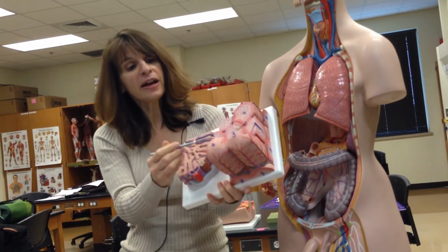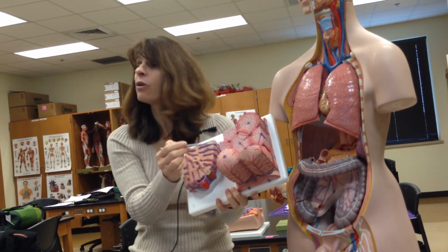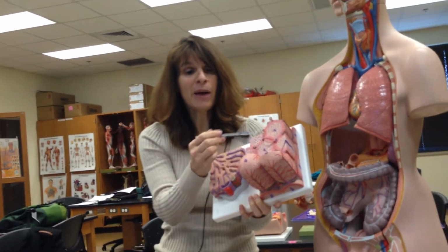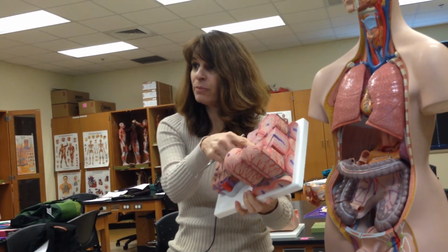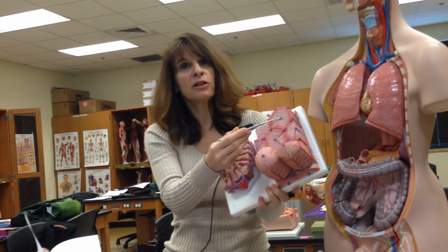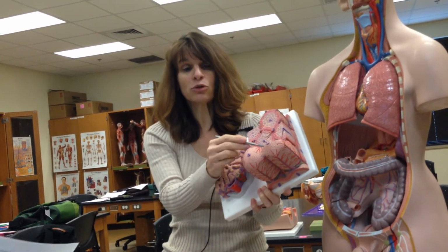Liver. Identify each of these structures right here. These are, I'm sorry? Hepatic lobules. These are hepatic lobules. These are within this liver, hepatic lobules, the structural and functional units. What do I call these purple circles in the middle? Central veins. They're central veins.